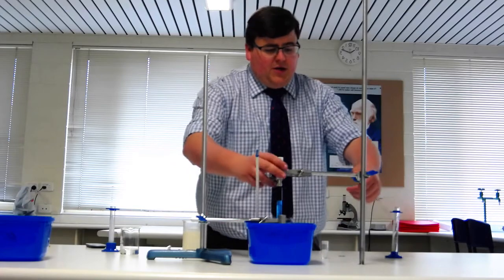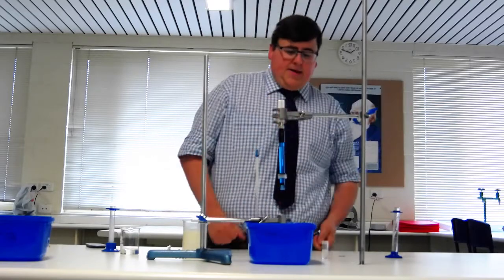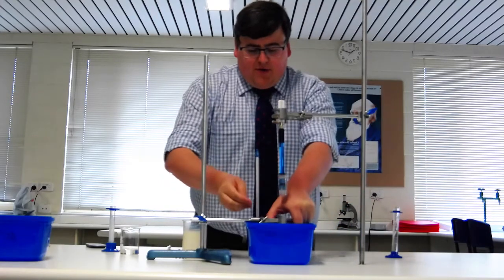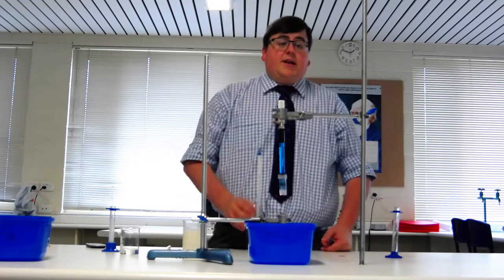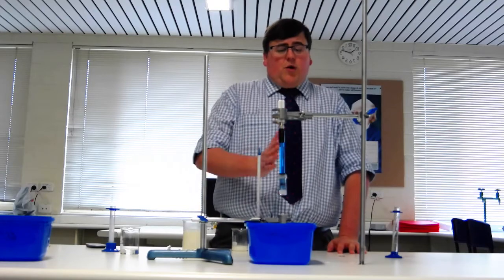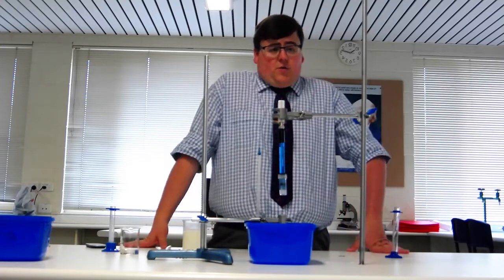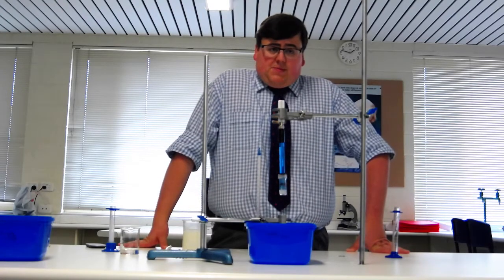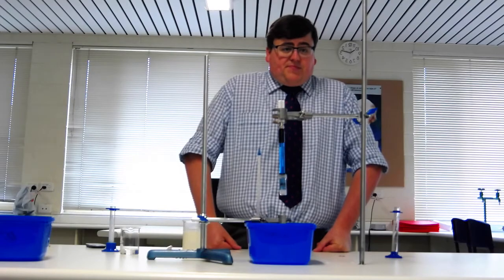Once the experiment is finished, remove the pH probe and put the cap back on, then remove the solution and start the next concentration. I would start with the 1% concentration of lipase and gradually work your way up to the 5%. Because this takes 10 minutes per trial plus 5 minutes to acclimatise, this is going to be a long experiment and you'll only be able to do each trial once. At the conclusion, make sure you collect data from at least 3 other groups and share that data so you can work out the averages. Good luck!